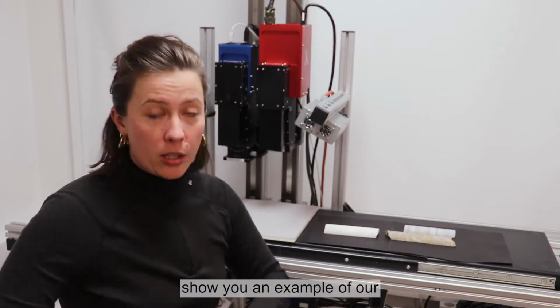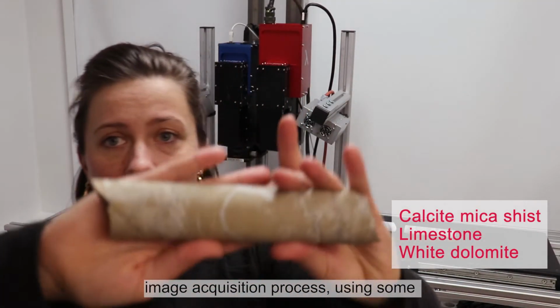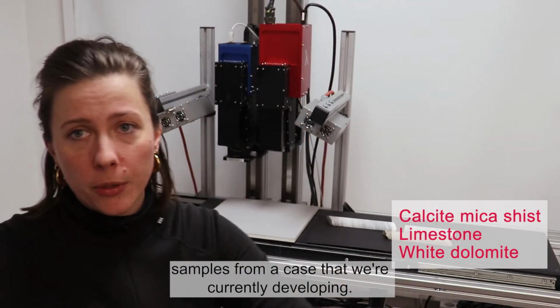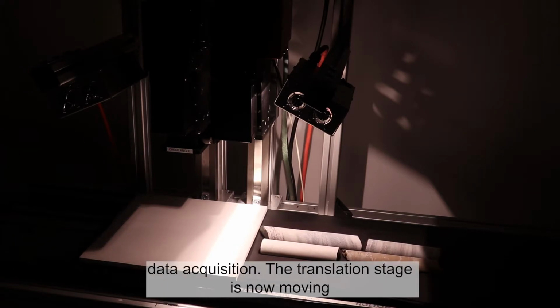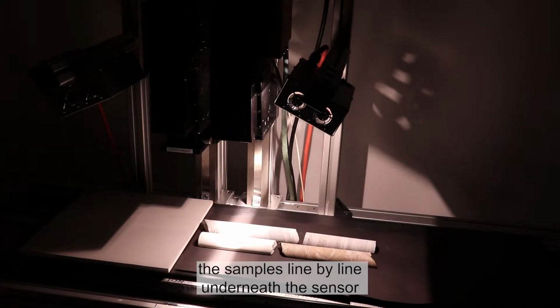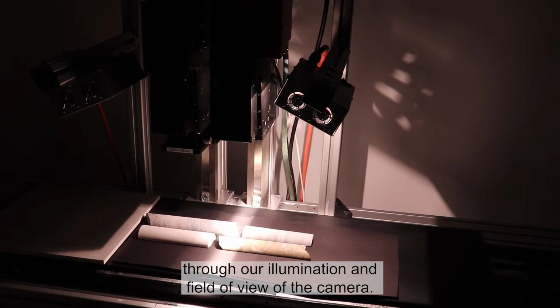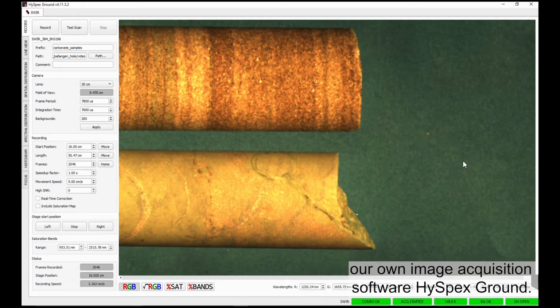Today, we are going to show you an example of our image acquisition process using some samples from a case that we're currently developing. Now you can see the data acquisition. The translation stage is now moving the samples line by line underneath the sensor through our illumination and field of view of the camera. For recording new hyperspectral data, we use our own image acquisition software, HySpex Ground.